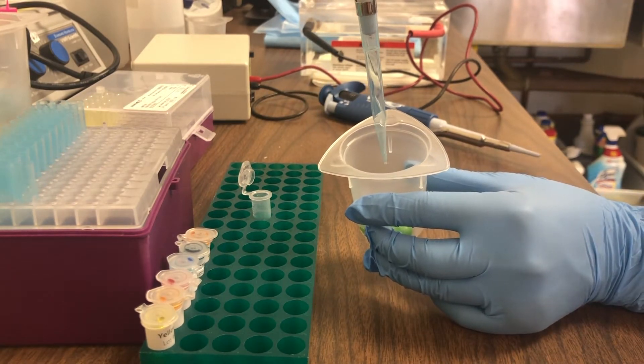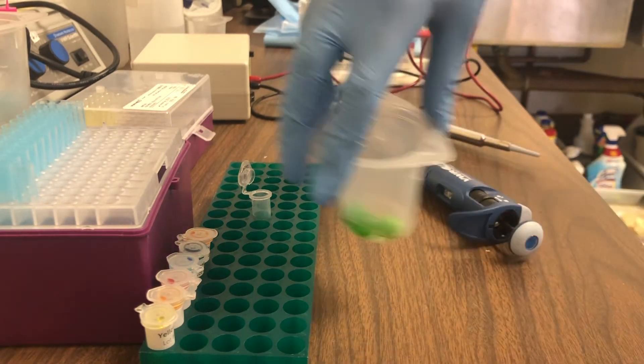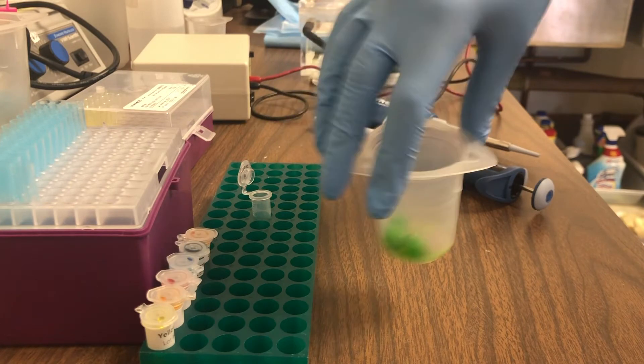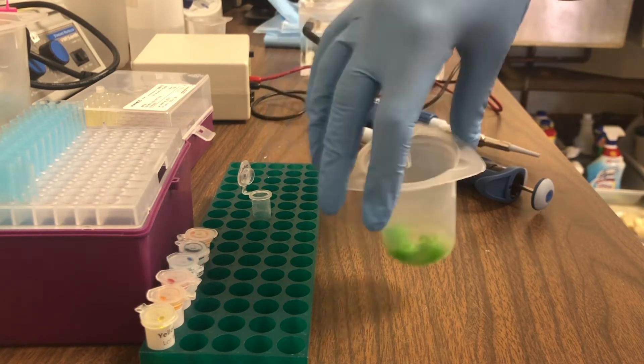Acetic Acid is a little bit like vinegar, and it smells that way. What we're going to do is add that to the Skittles and stir it around for a bit, maybe 30 seconds or so.